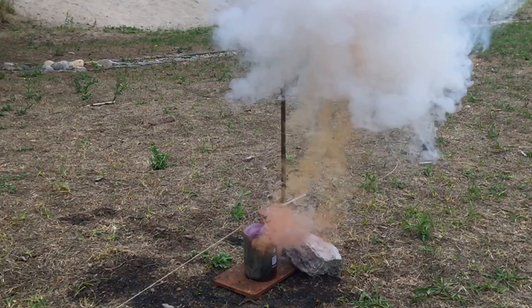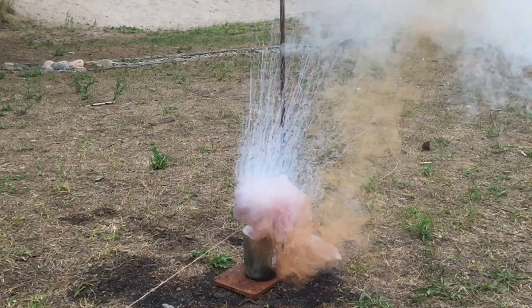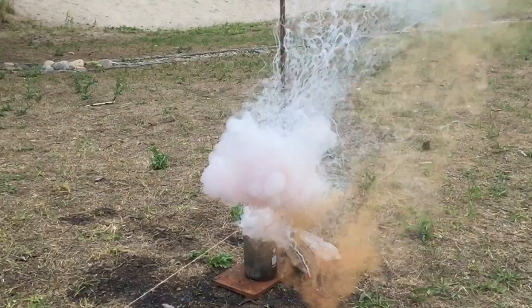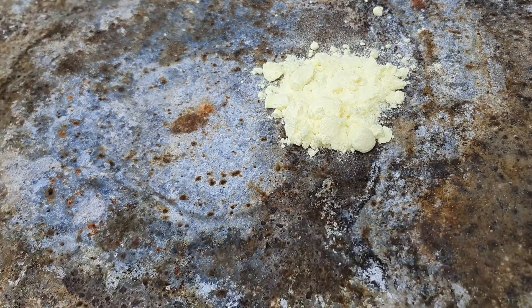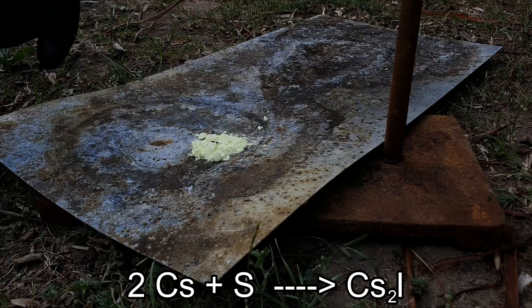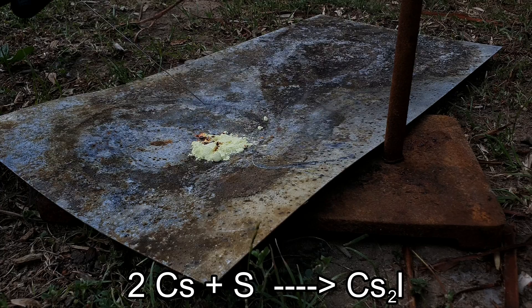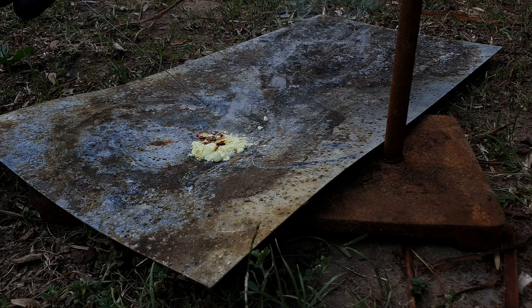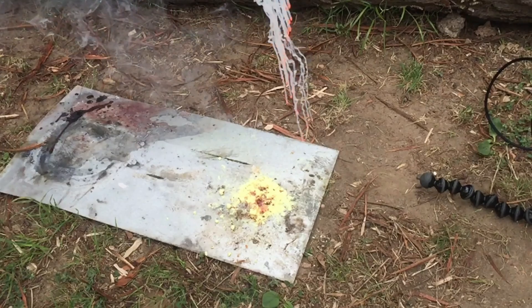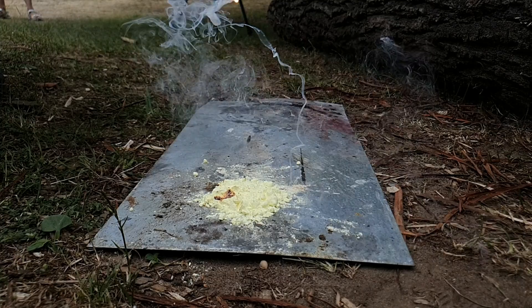So if you want to see this repeated with bromine, let us know. We also tested the reaction between cesium and sulfur to form cesium sulfide. The reaction was relatively boring and the cesium caught fire as soon as it left the syringe, but it looks nice so I thought I would show it to you.